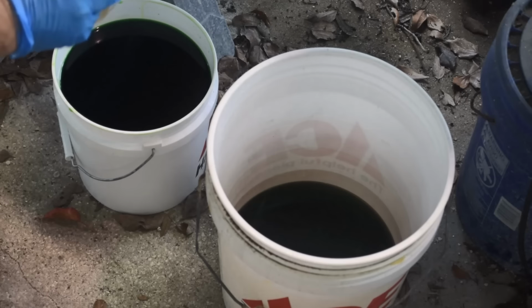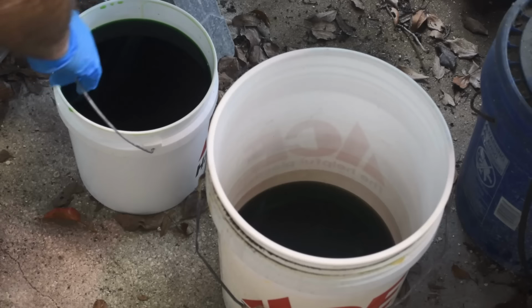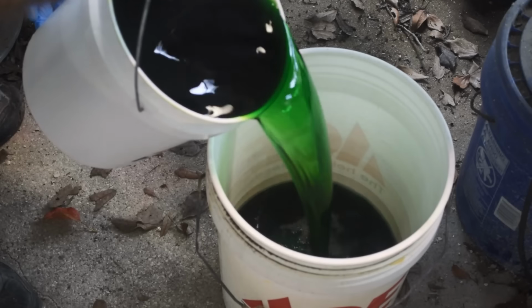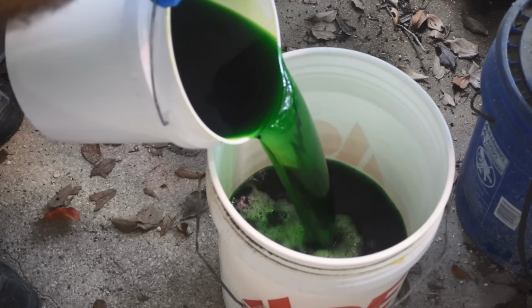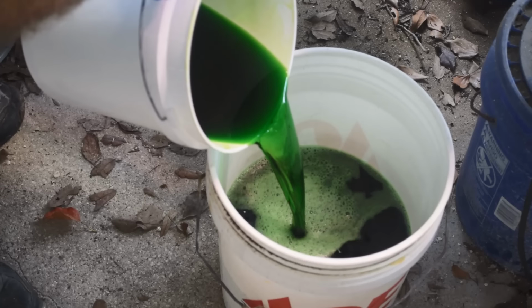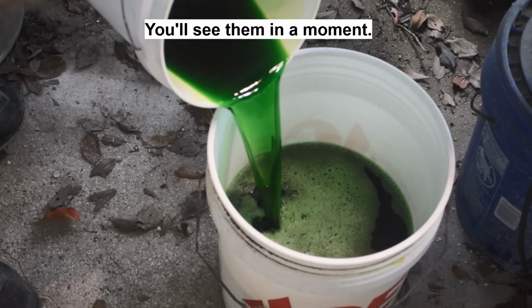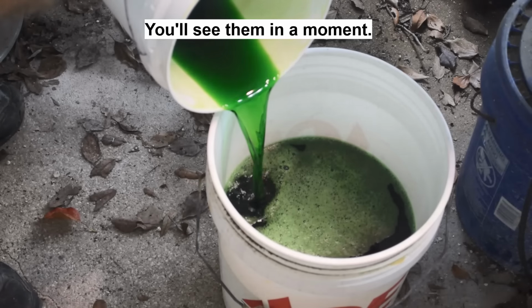So let's see here. There's probably a whole lot of ammonium chloride and maybe some other salts that have come out of solution on the bottom of this bucket. I don't necessarily want to dump them in, but I will dump this deep green liquid in here. Oh yeah, see the crystals in there? I'll figure out what to do with those, but for now I'm just going to dump the liquid in here.